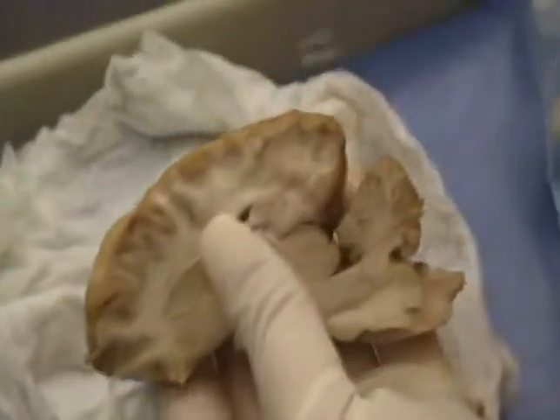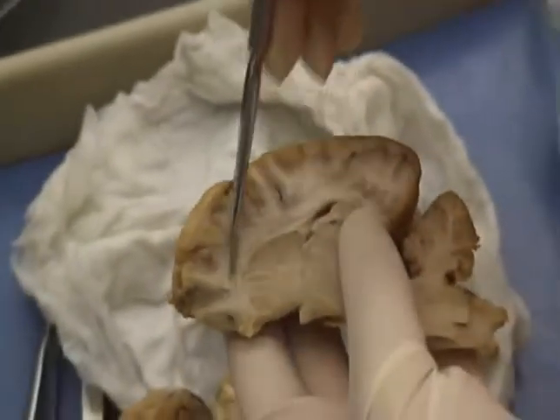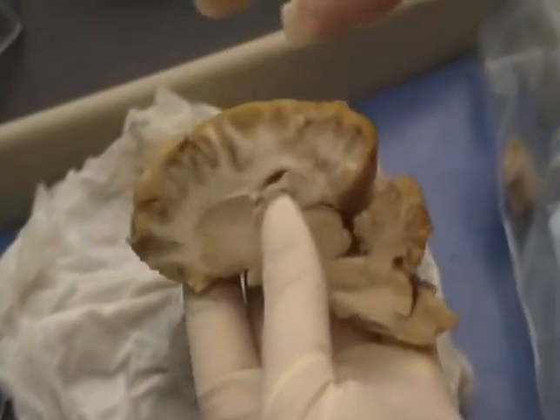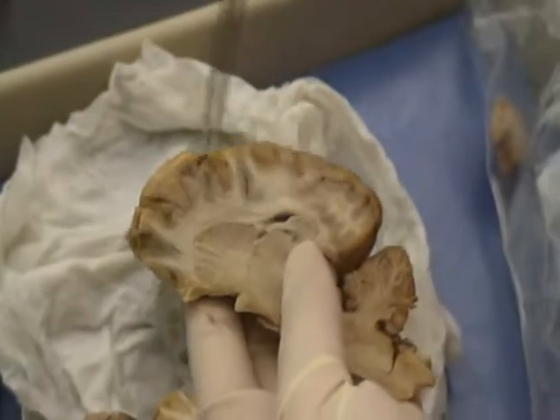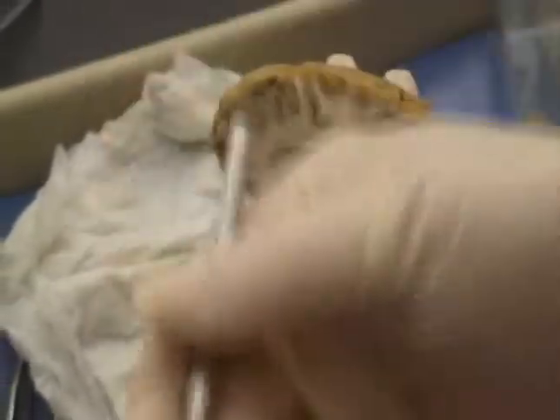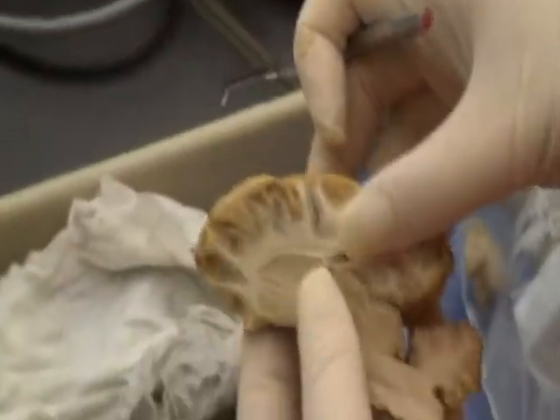Okay. The cerebral cortex is the outer gray matter, and then there are white tracts inside, white matter inside. So the gray and white matter make up the cerebrum. The white matter is a bunch of association tracts. Association tracts are within the same hemisphere. Commissural tracts are from one hemisphere to the other, and projection tracts are from the cerebrum to the diencephalon or to the medulla or to another part of the brain.